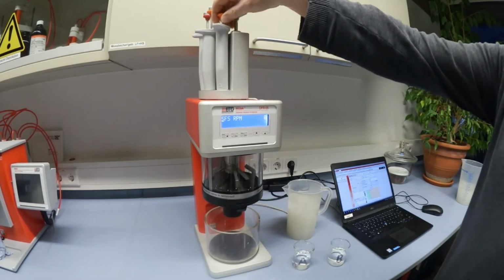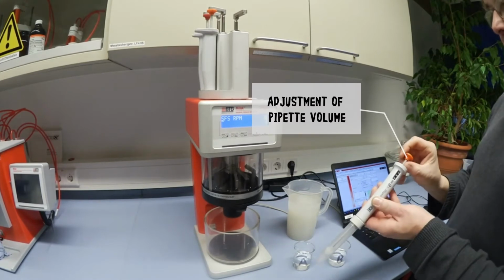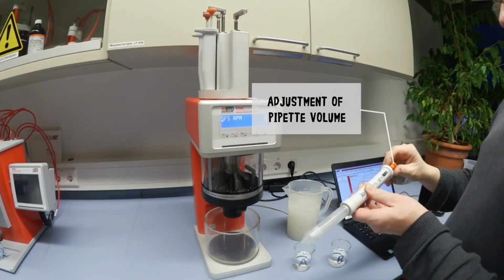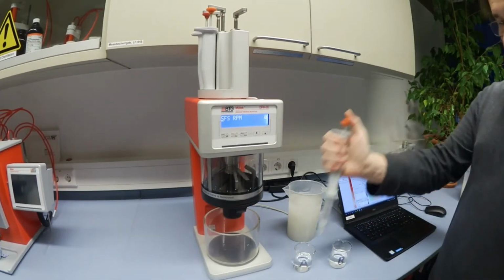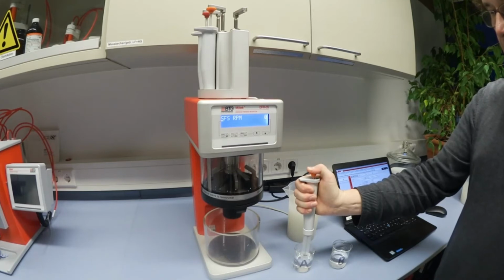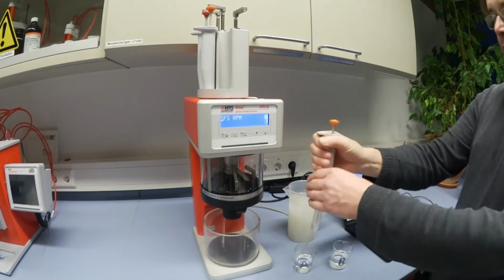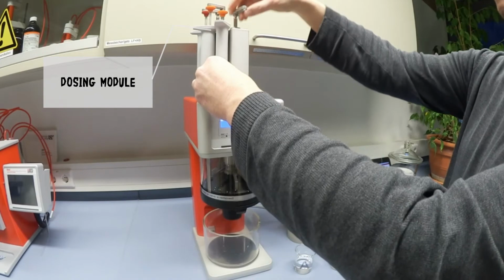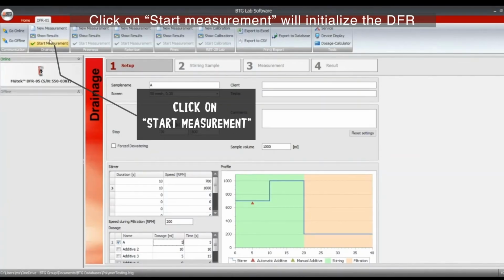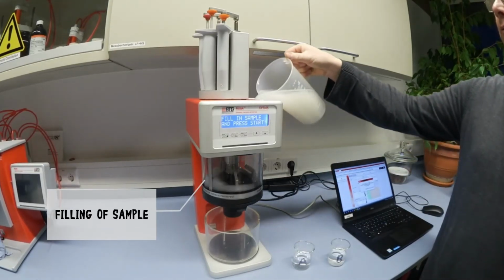Now the pipette needs to be loaded with the additive. At first, the volume needs to be adjusted to 5 milliliters, and the additive A drawn into the pipette. Then the pipette is put back into the dosing module. You will now click in the software on Start Measurement, which will initialize the DFR for the measurement, and then the sample can be added.